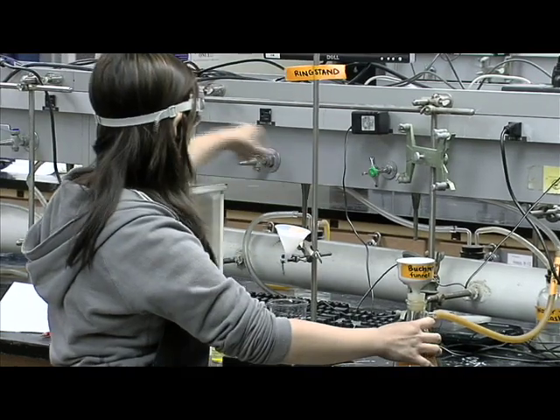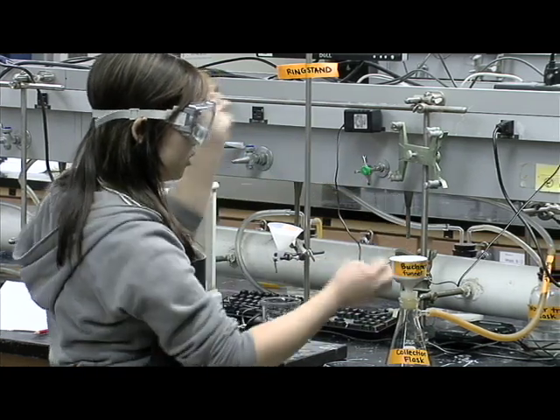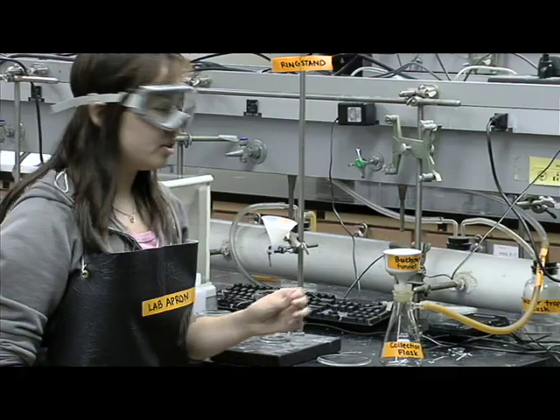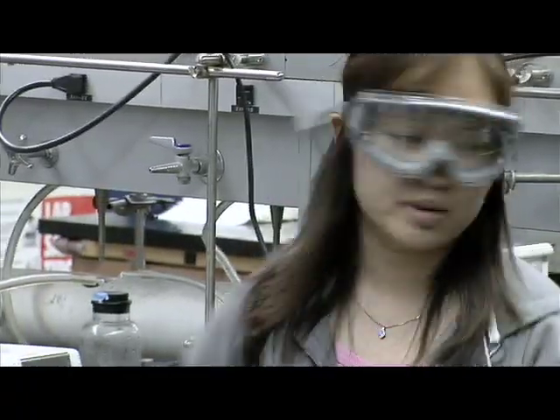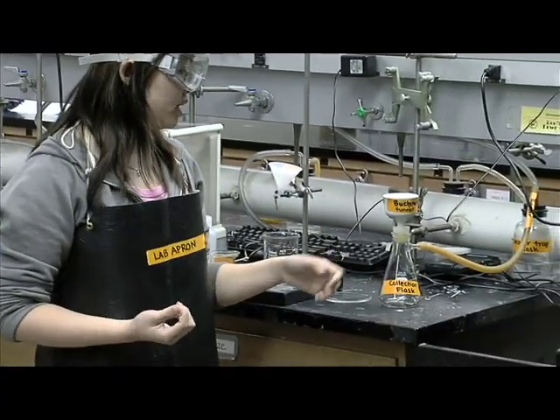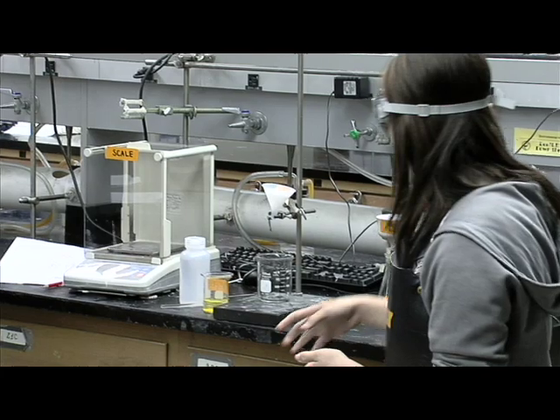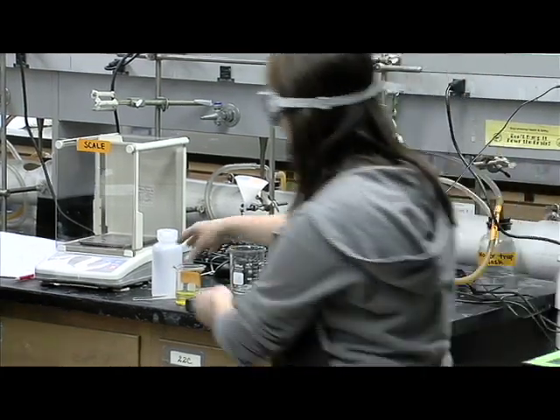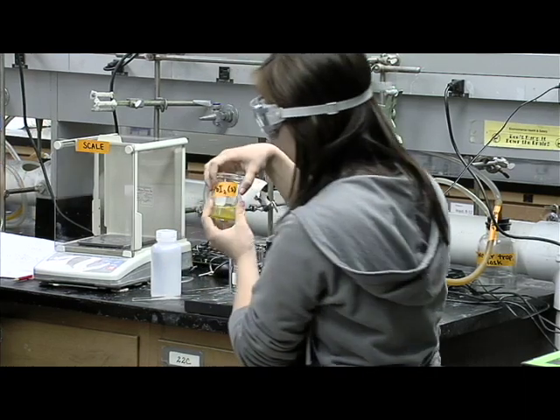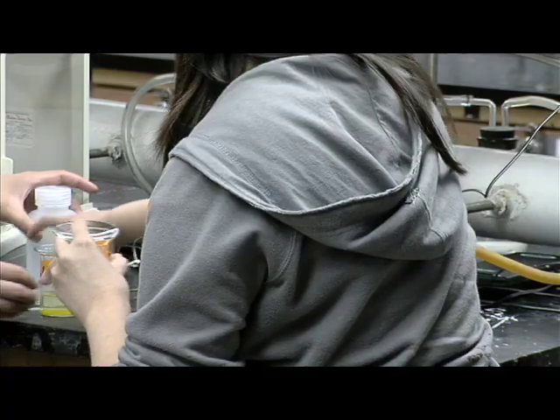After making sure all the rubber tubing is connected tightly, you turn on the vacuum and it should pull the filtrate out. We're now going to race between gravity filtration and vacuum filtration to see which is faster. We both have equal amounts of lead iodide — 40 milliliters. Okay, I'm going to turn on my vacuum first.